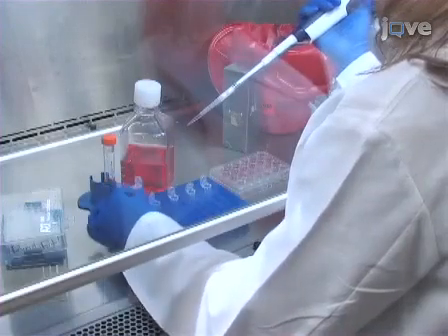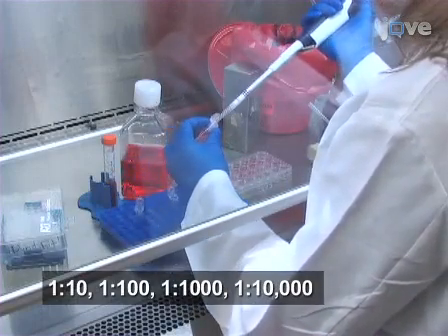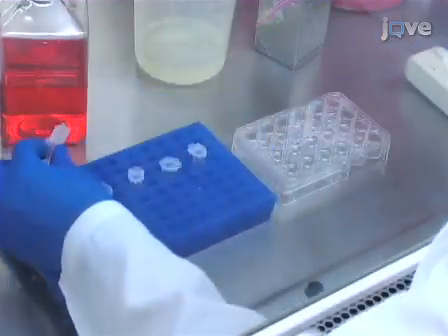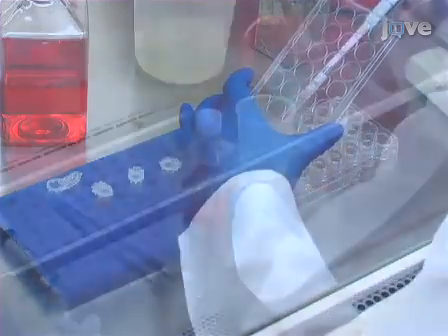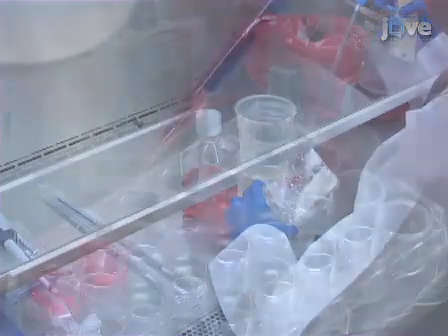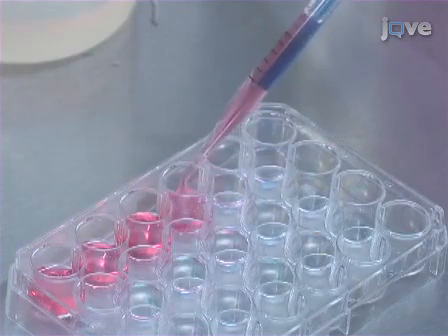To titer virus, make serial dilutions of a fluorescent control virus in fresh antibiotic-free media with 6 micrograms per milliliter polybrene and use these dilutions to transduce cells of the appropriate cell line in a 24-well plate. The next day, change the media to fresh antibiotic-free media and then continue the incubation for a further 2 days to allow the cells to express the fluorescent protein.